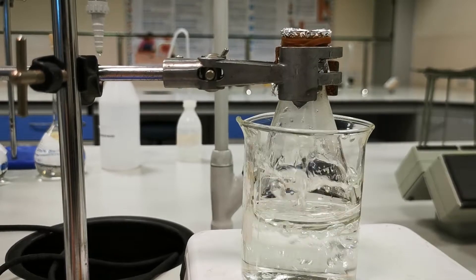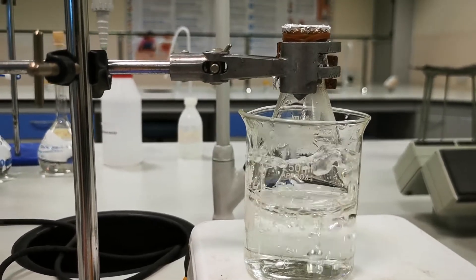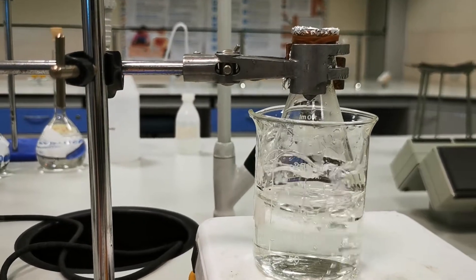When I don't have any more liquid, I will remove it, and then measure its mass, the mass of the gas, again.